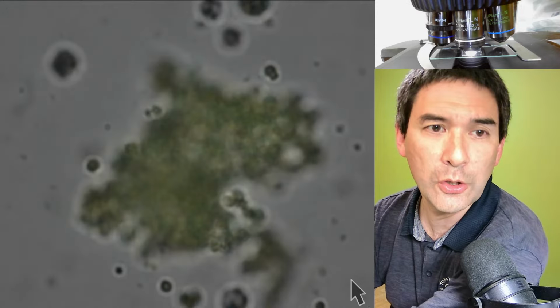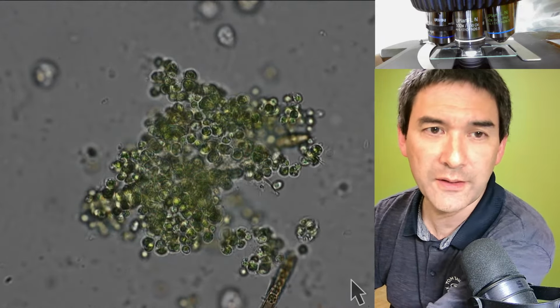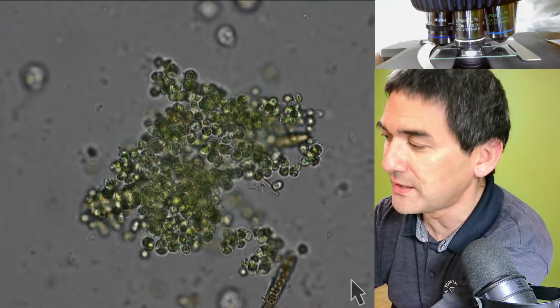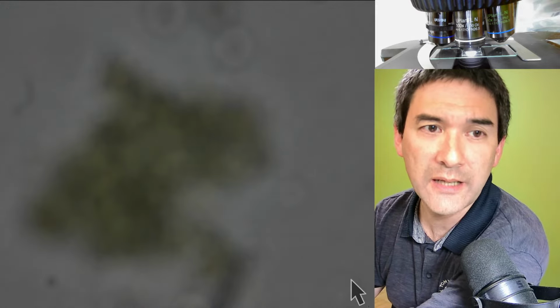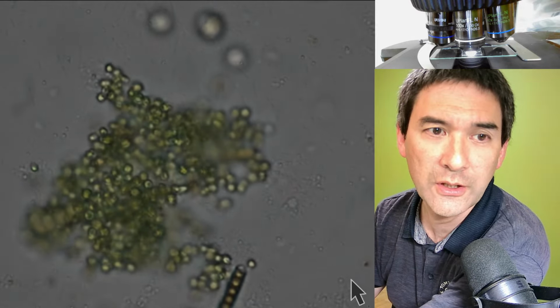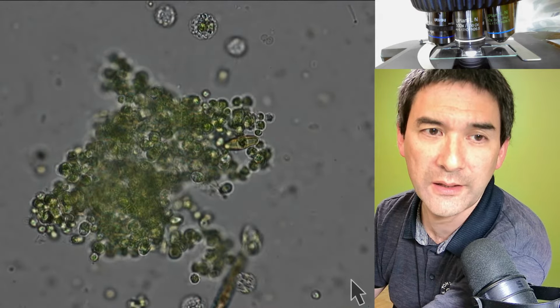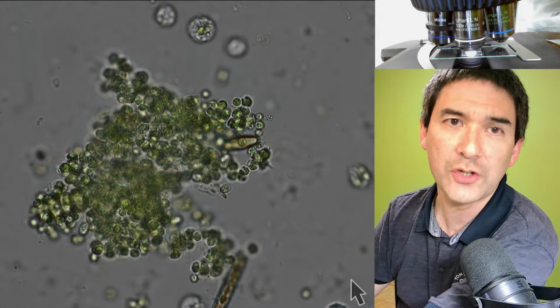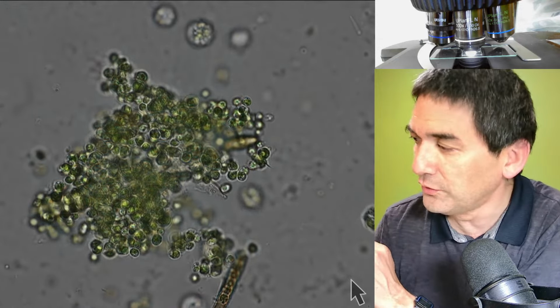Now I lost the oil film a little bit. Okay, here we go again. But that's the convenient aspect: it remembers the position. I go out, I could coarse focus, I could exchange the slide, and I basically move back into focus again. Okay, this was the oil film that started to form again. And there's no danger for me of crashing the objective into the cover glass. So this is a very convenient feature.